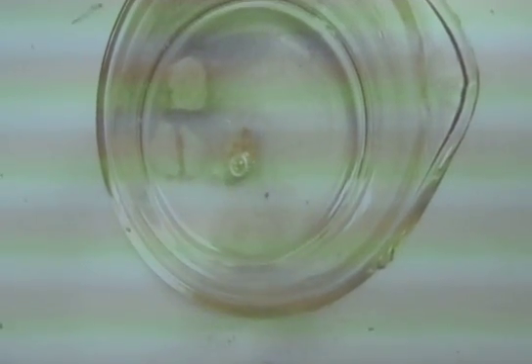See, the bubbles are kind of collecting underneath. The little bubbles are being amplified on the surface there. You can record that on camera? Yeah. So, that's how that works.